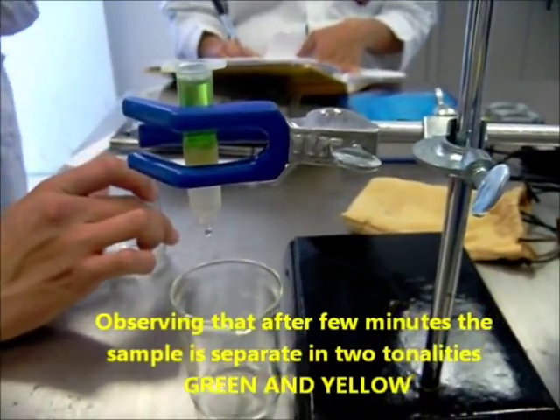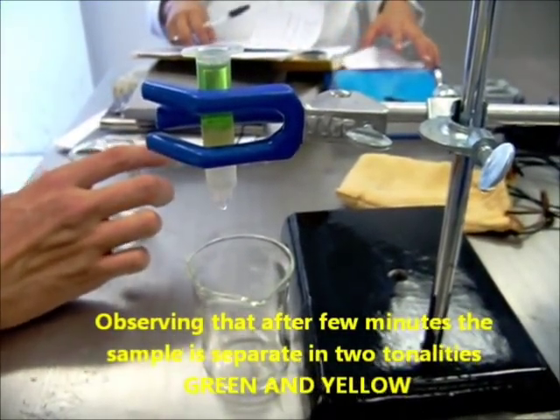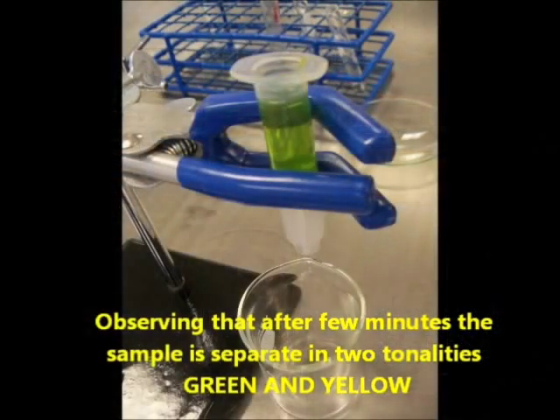Observing that after few minutes, the sample is separated in two colors, green and yellow.